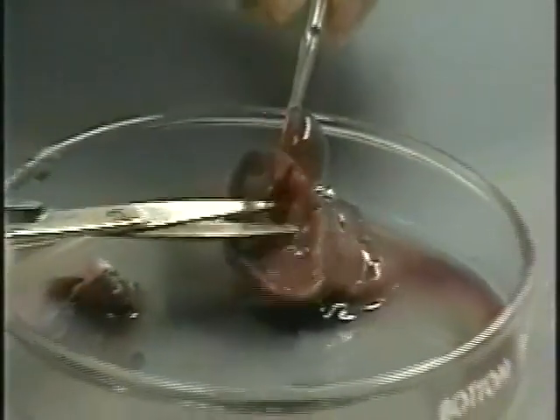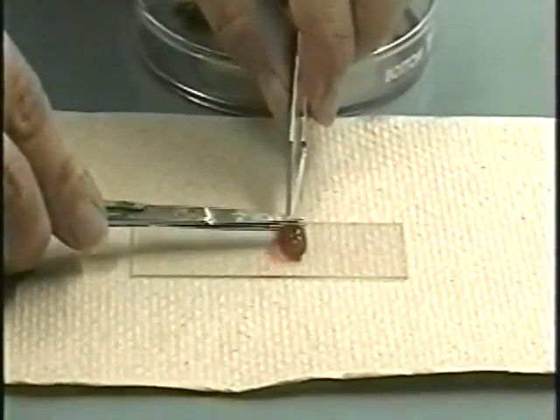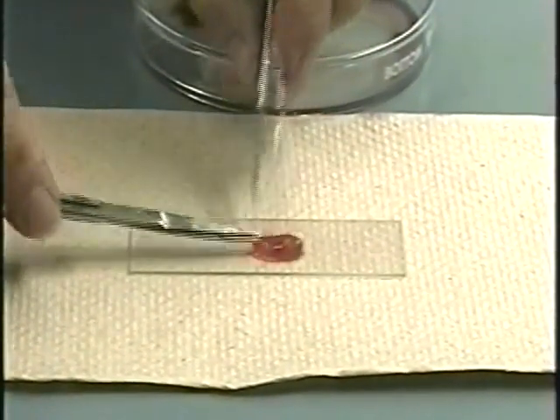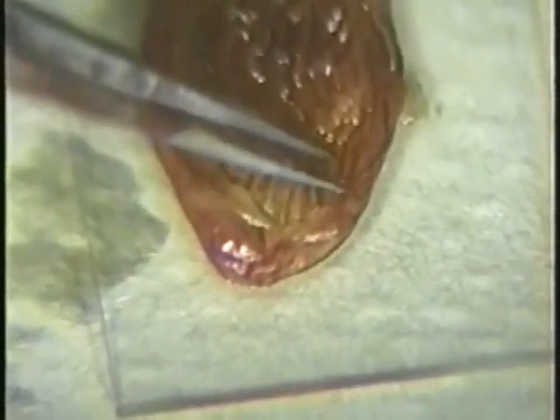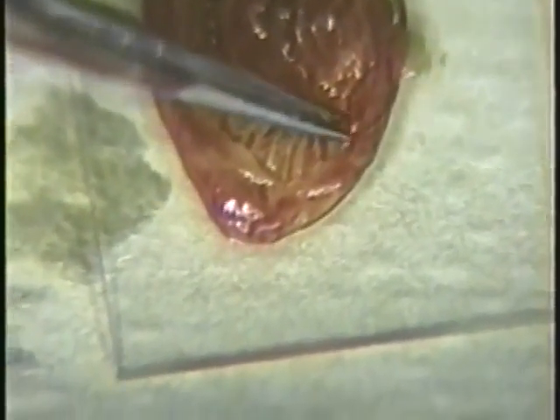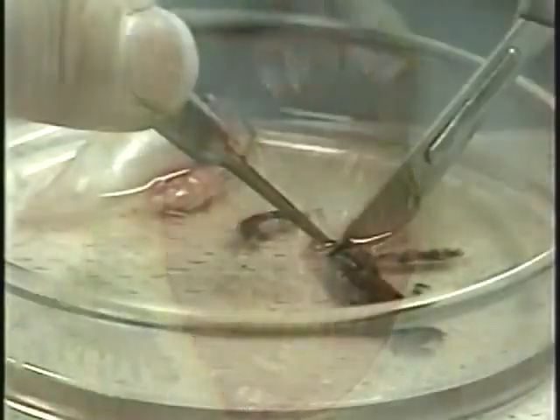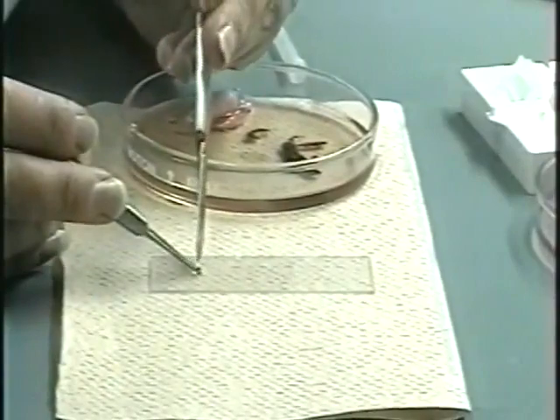The intact gallbladder can be placed directly on a microscope slide and teased apart to examine as a wet mount, or if large enough, the fluid can be extracted using a needle and syringe and examined directly. Parasitic worms may encyst in the walls of the bladder, and myxozoan parasites are often present in the fluid. After thoroughly examining the digestive tract, examine the other organs.